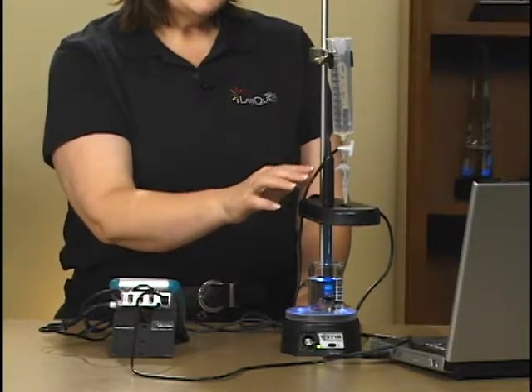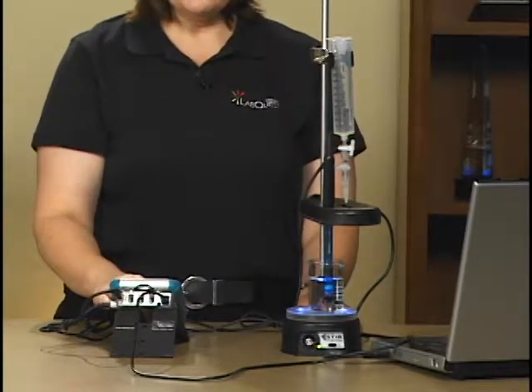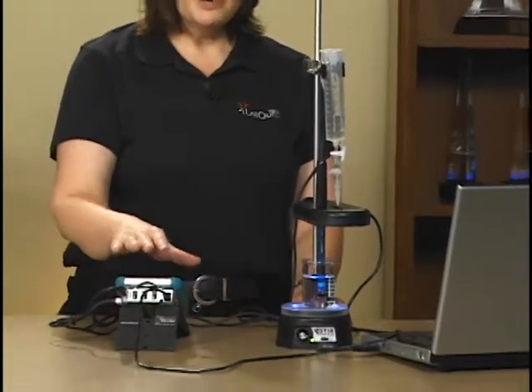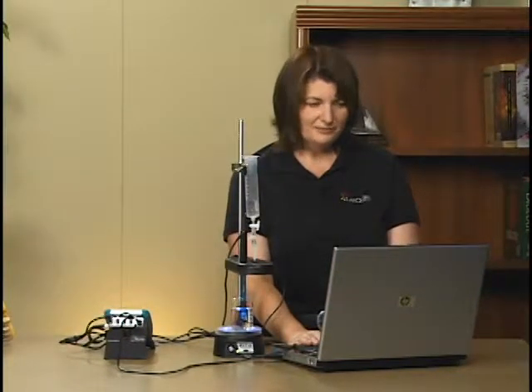These two sensors, the drop counter and the pH sensor, are connected into the LabQuest interface. And for this particular lab, we're going to attach the LabQuest to a computer through a USB cable and control the titration with Logger Pro on the computer.